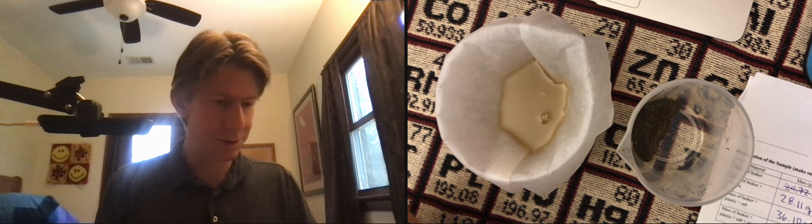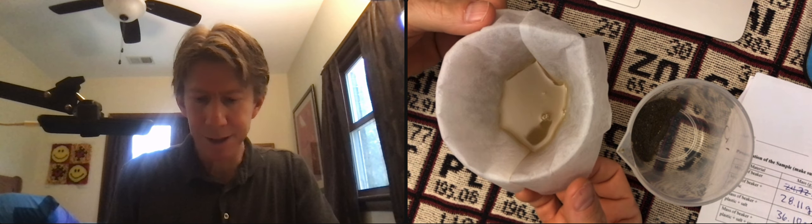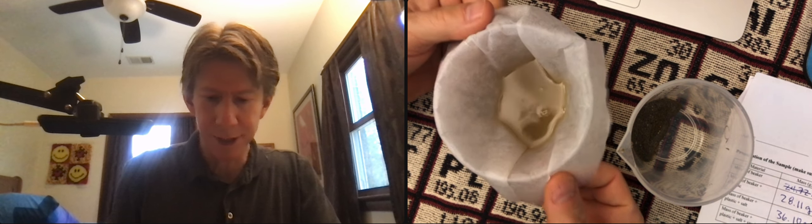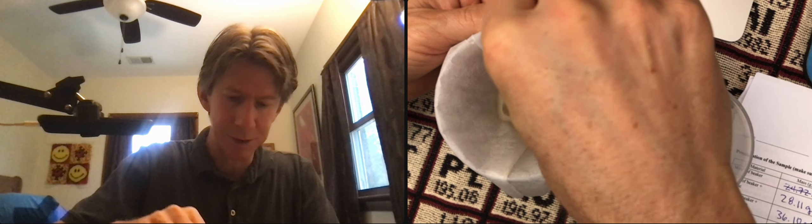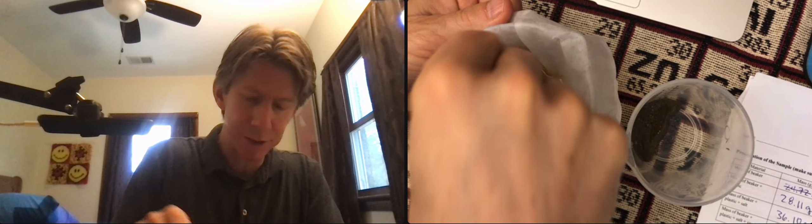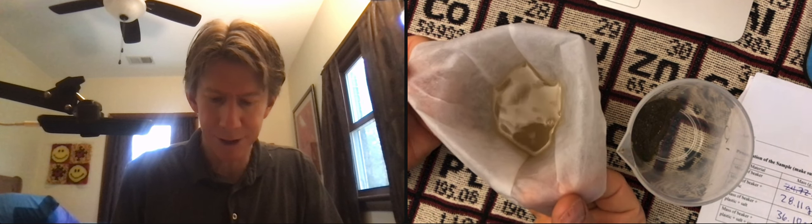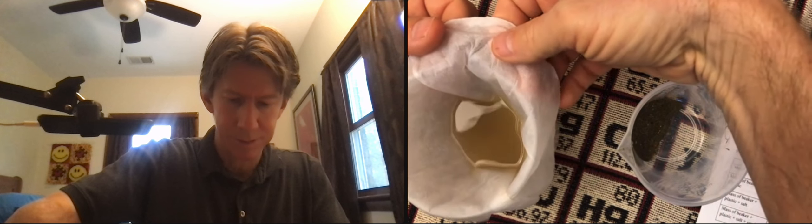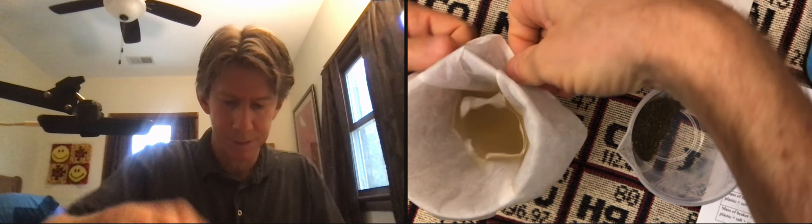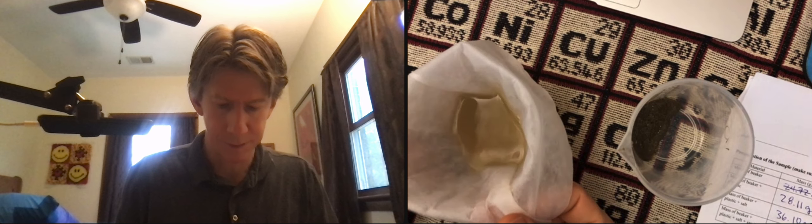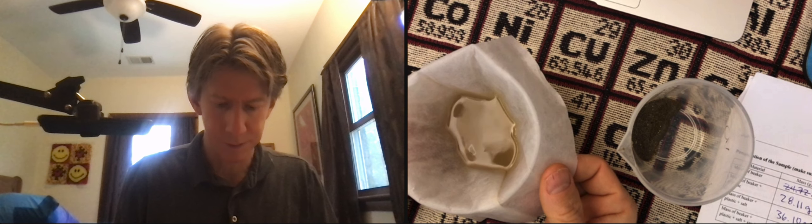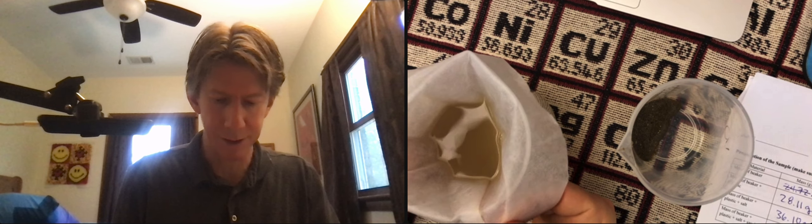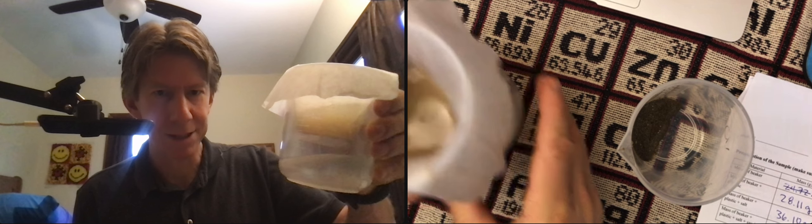And I am going to move up my filter paper a little bit. So I'm going to pull it over the sides a little bit more, being careful not to tear it. Let's see if I can get a little higher there. Let's see how we're doing from the outside.